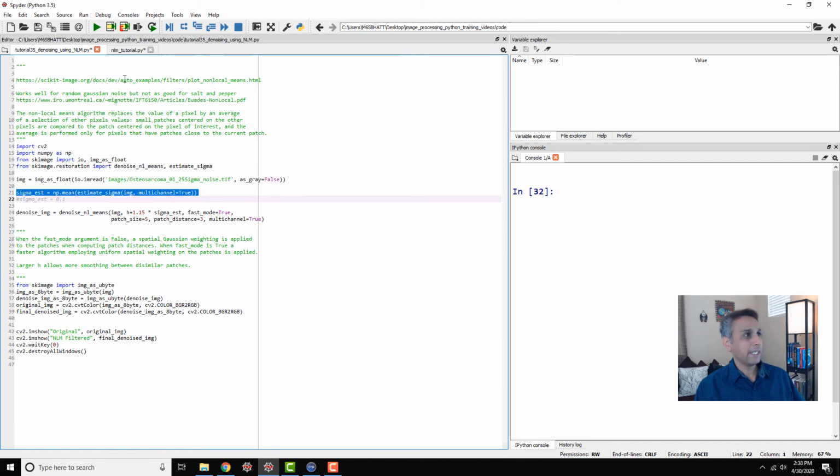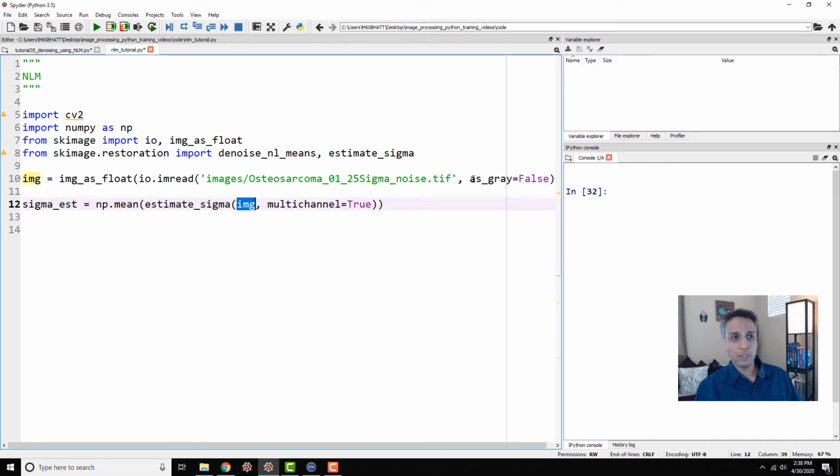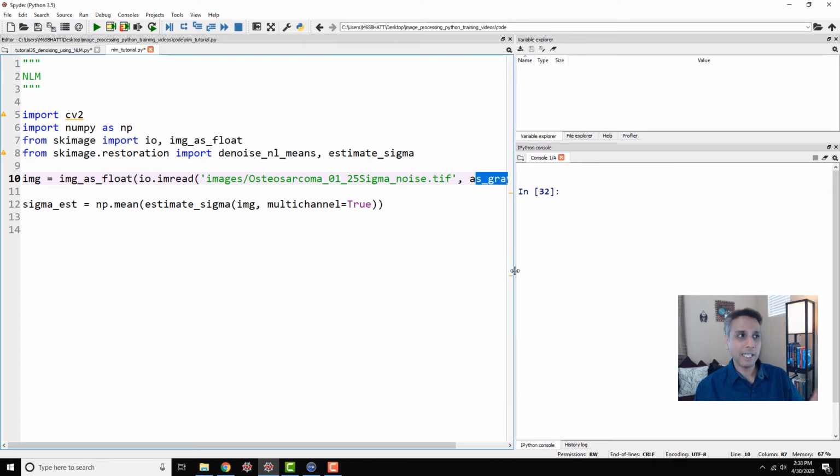Let's go ahead and estimate sigma. The way you estimate sigma here is, again, we are importing this estimate_sigma right there. So we are going to estimate the sigma of our image. And by the way, in this case, let me expand this. I'm going to put as_gray equals false. So we are going to work on a color image as is, all three channels, because this specific function, non-local means, in scikit-image works on a color image or a grayscale image. So while estimating the sigma, I'm saying multichannel equals true, so it's going to get the sigma from all three color channels. And I'm going to look at the mean value right there, okay?